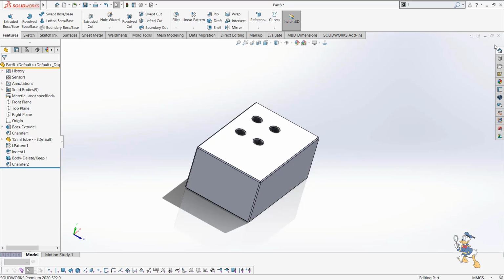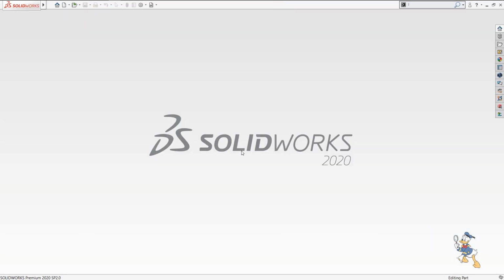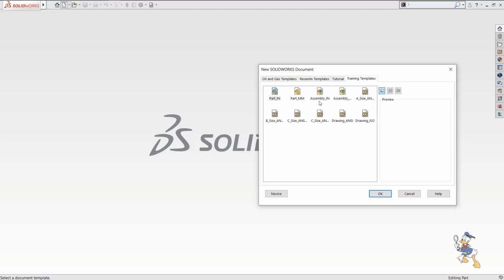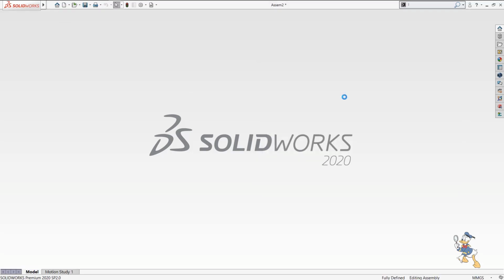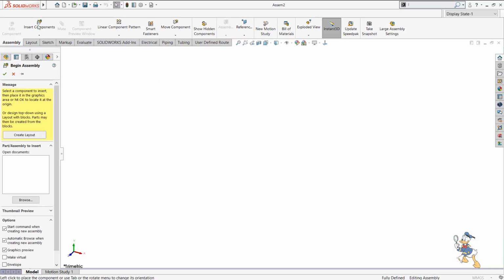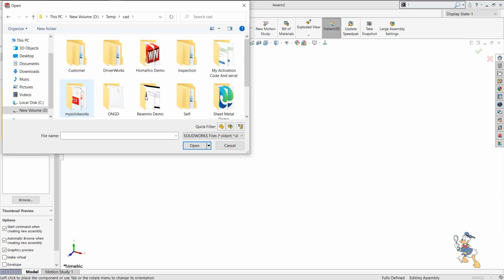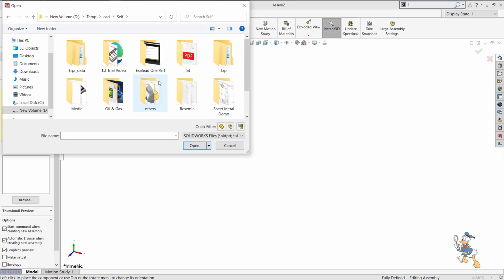So let's move to the assembly, how we can assemble this part, and how the assembly is going on. So let's move into the assembly. I just need to select a template over here. Then I just need to provide the components which we have designed right now. I just need to select the place where I need to design an assembly.